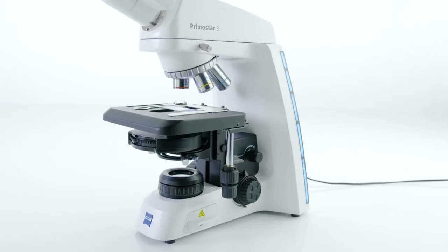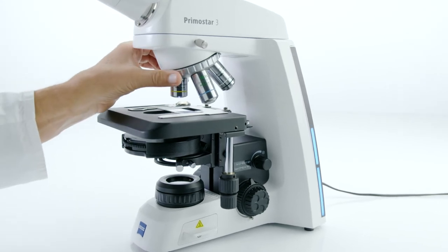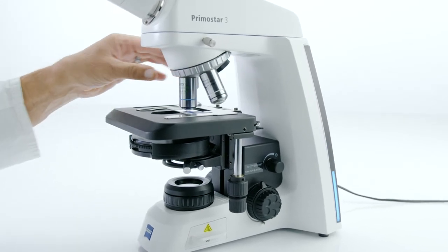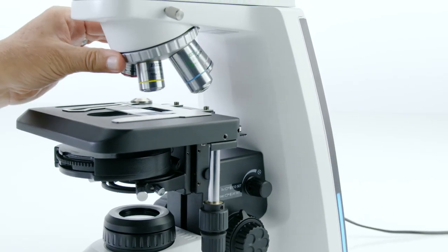So now, whenever you change the magnification by turning the objective turret, the light is automatically adjusted. That's because the Light Manager has remembered the setting from the last time the lens was used.